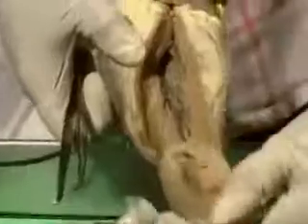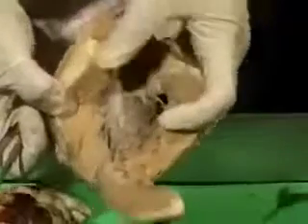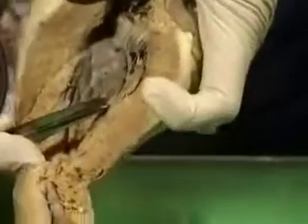Now let's look at the left ventricle. This is the left ventricle. Look at the thick left ventricular wall. See how thick it is. And see the right one. So you can see how much thicker this is, 3 times as thick as this. And here you have 2 openings. One is the left atrioventricular opening, which has only 2 cusps. So here's one, and then there's one at the back, and here you can see the chordae tendineae. You can also see a nice papillary muscle up here.